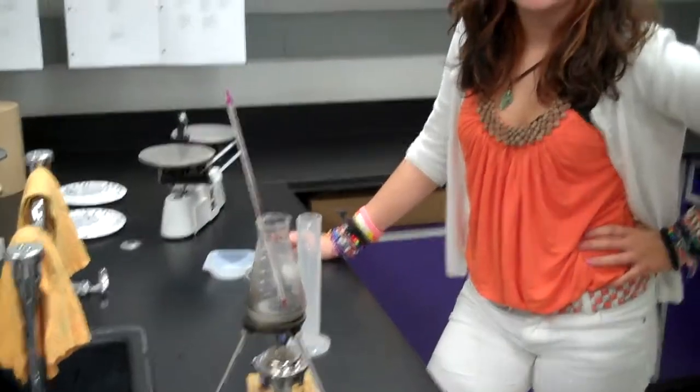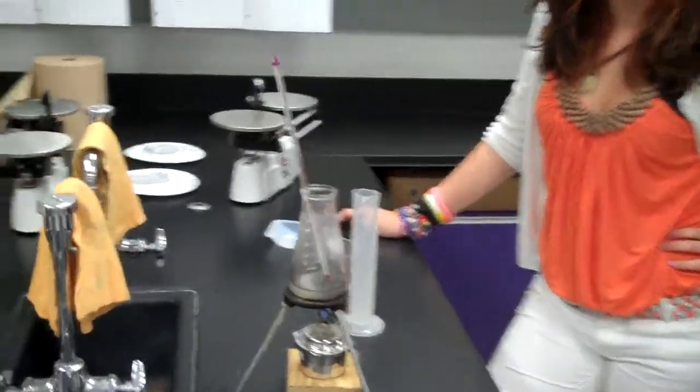Okay, here we are. It's the first day of school. How are we doing? The Seed Crystal Lab.